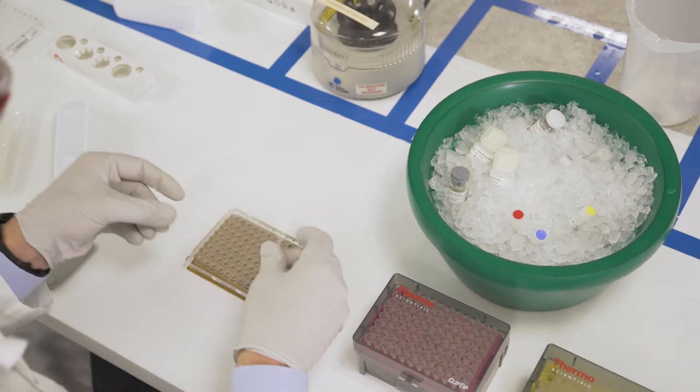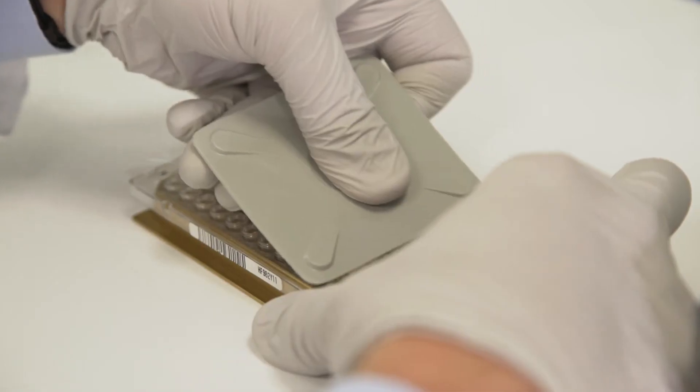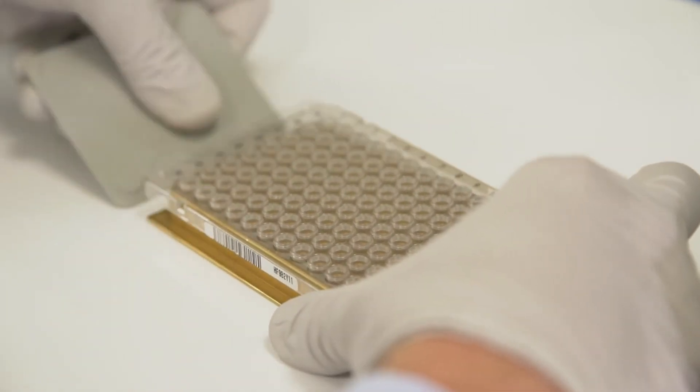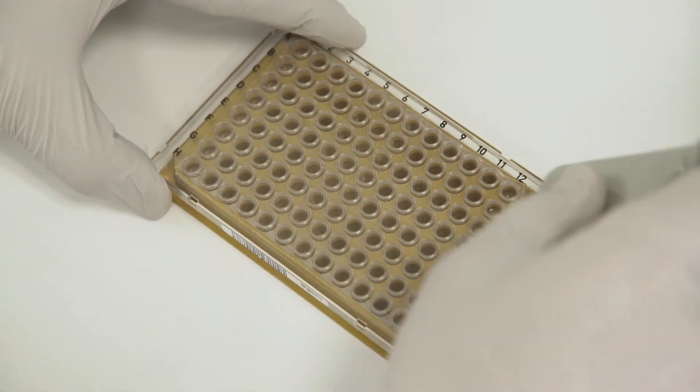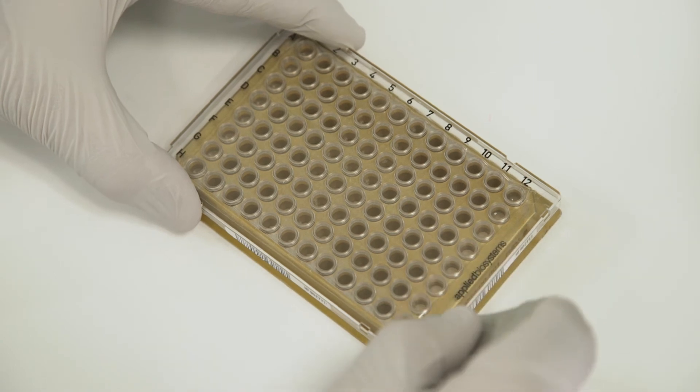Cover the plate with an adhesive seal using the plate seal applicator to ensure complete adherence, especially along all the edges. This is important to avoid any evaporation and contamination between wells during the next mixing step.